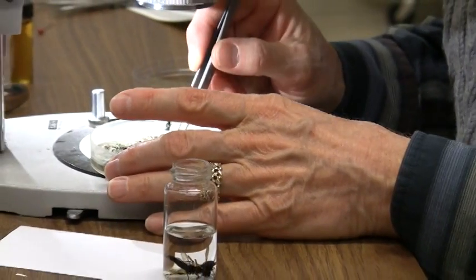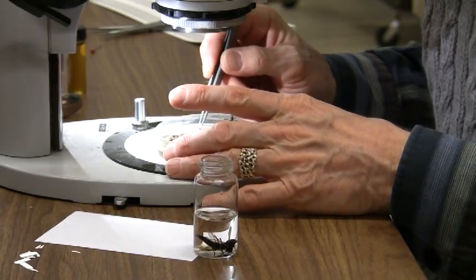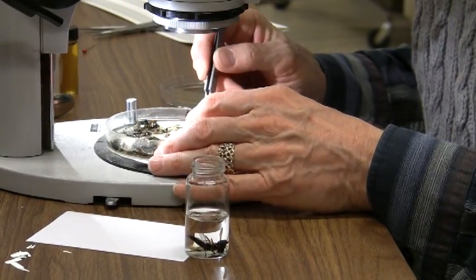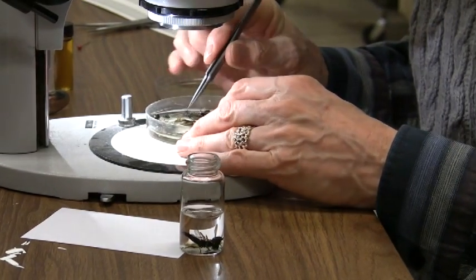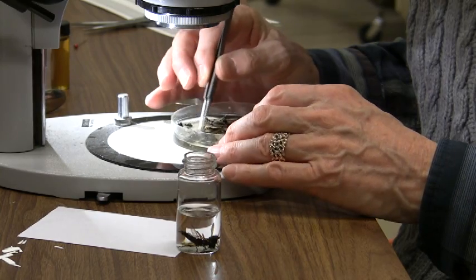We're only dealing with adult insects. There's a number of caterpillars in here, and of course these aren't really of much use to us for this collection, so we'll just leave them be. There are also spiders and things like that, but those aren't particularly relevant as well.